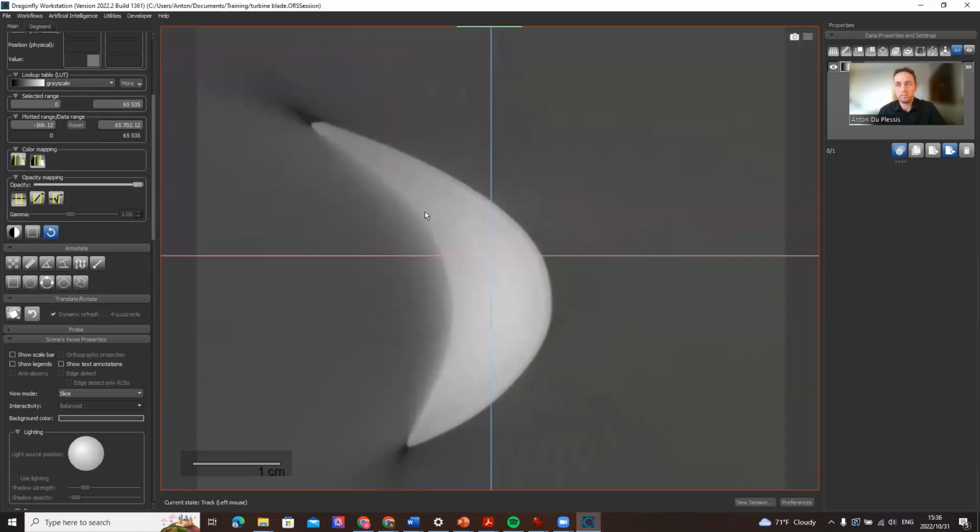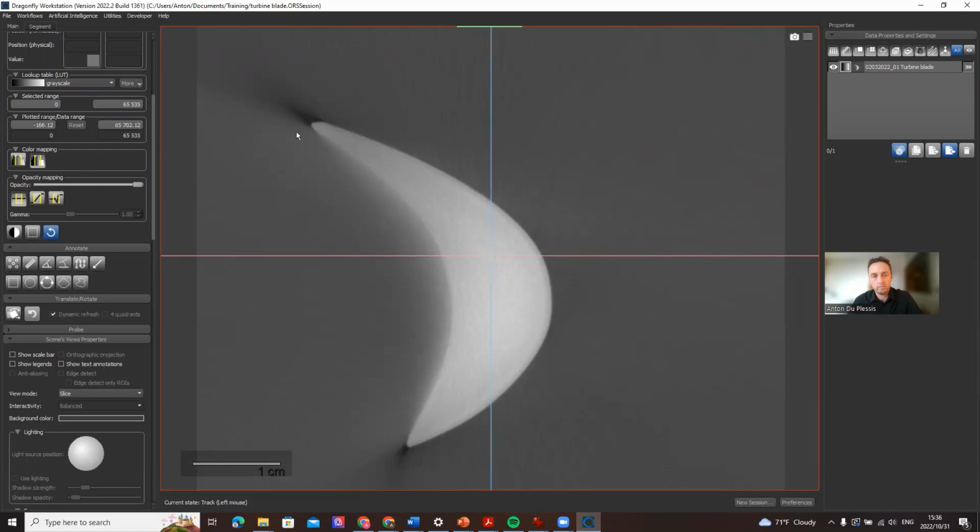So you might find it useful when, for example, you have beam hardening artifacts, as in the case here with a turbine blade where the tip of the blade is darker than the middle of the blade on the side. It can also be useful when you have simply a brighter side of an image, for example, when the top of the image is brighter than the bottom.